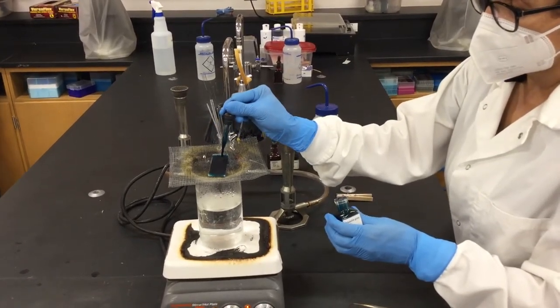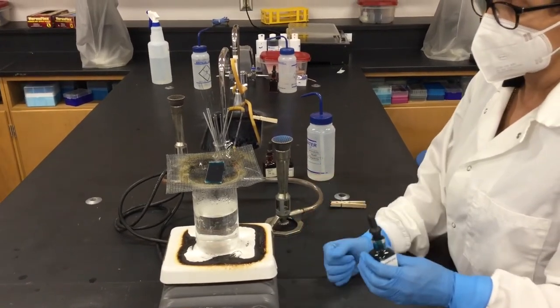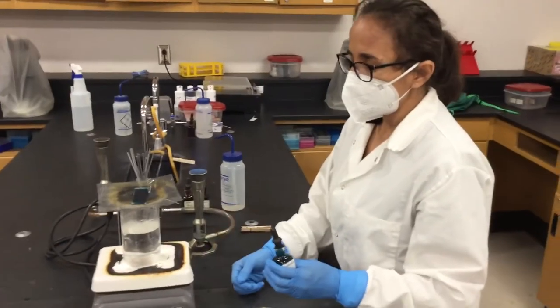So this is a type of strain that will release this endospores, or we have a lot of endospores for being starved for a week.